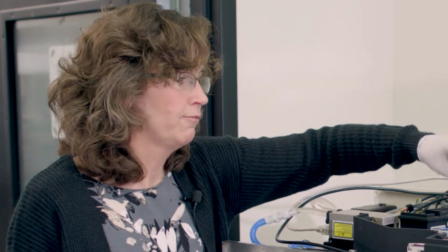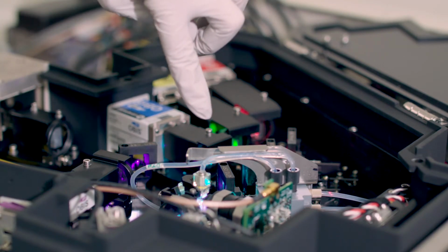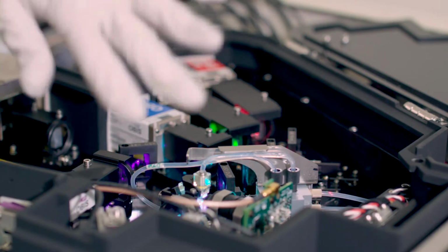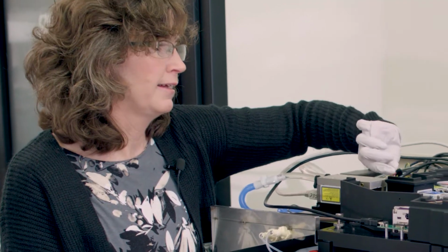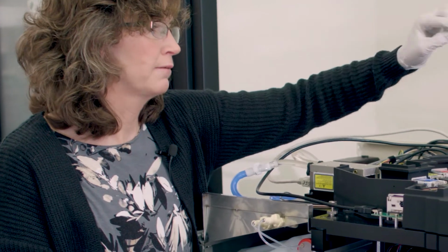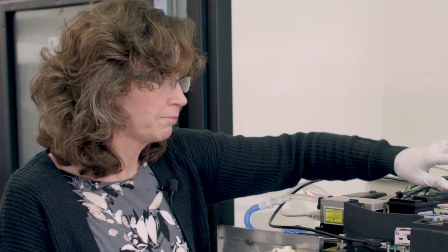I think the other interesting part is that all the lasers are pointing at the single flow cell, which is in the middle of this platform, and those cells are injected from down in the loader area up through the flow cell, and then end up going back down out of the system into the waste tank.